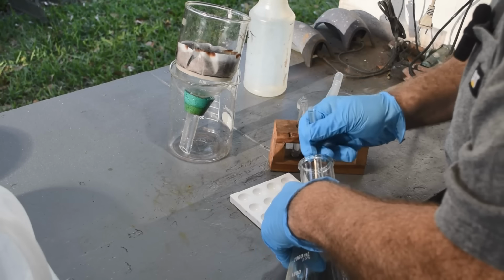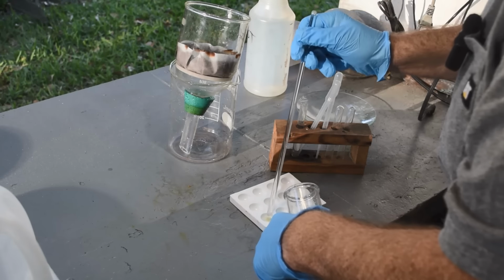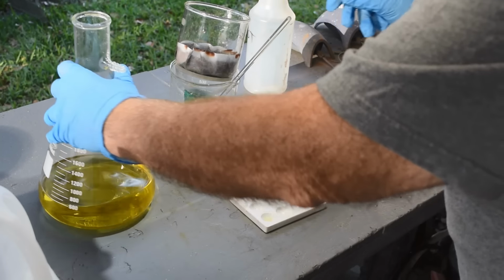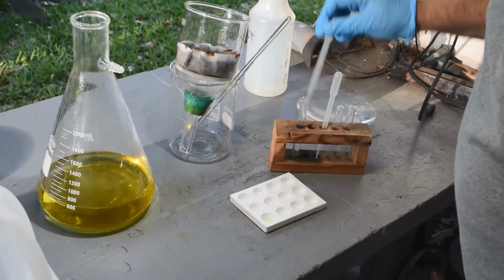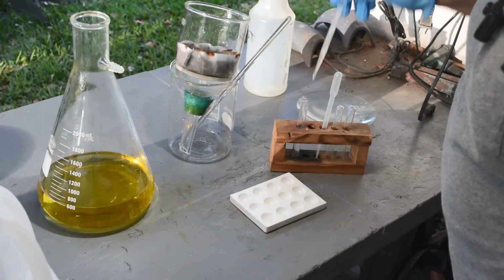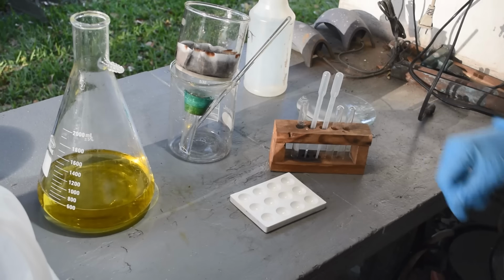The color is very suggestive. That doesn't mean there is any gold in it, but the color is suggestive. So, we'll check it. We don't want to throw any gold away. And there's nothing. Good. Absolutely nothing. Not even the slightest trace of purple.